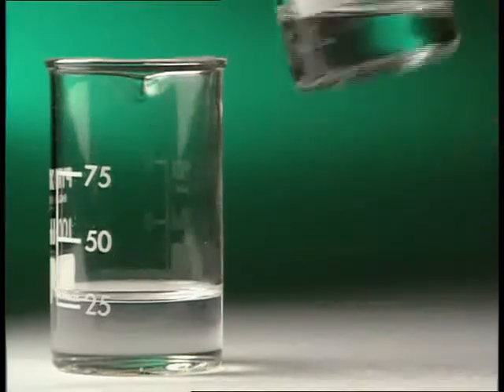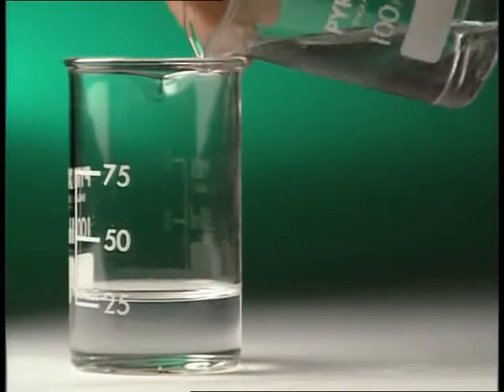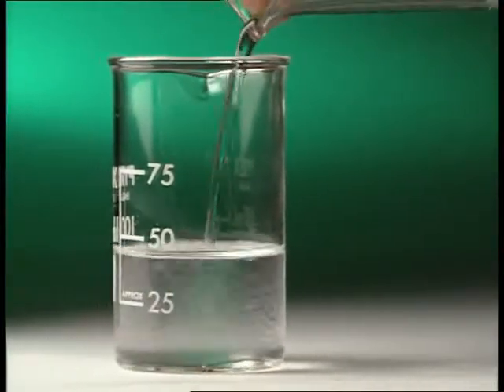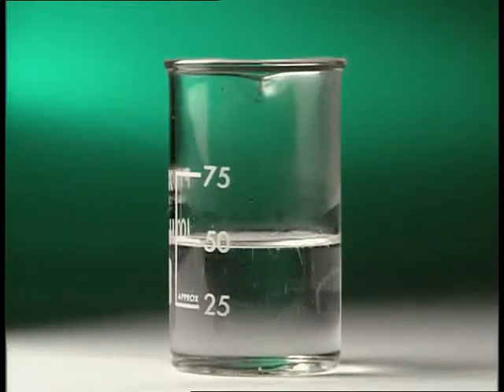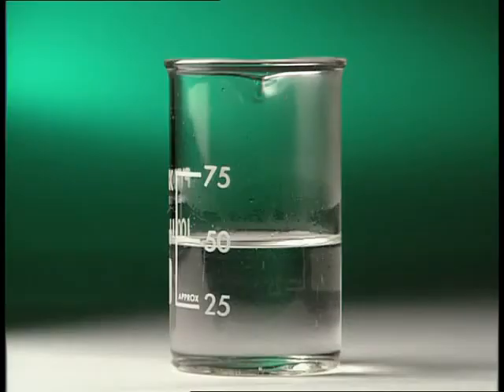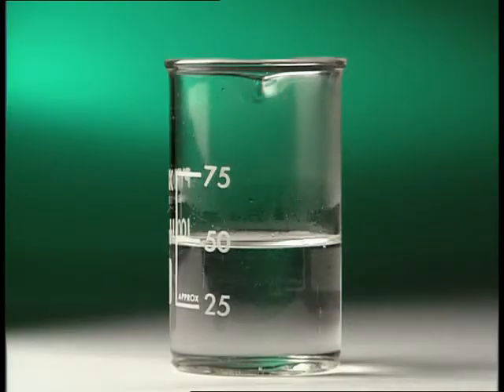But there isn't an obvious energy change when sodium hydroxide solution is added to sulphuric acid. Take another look, this time using a thermal imaging camera. Hot objects show up as white. As the two reactants are mixed, the beaker immediately gets hotter.